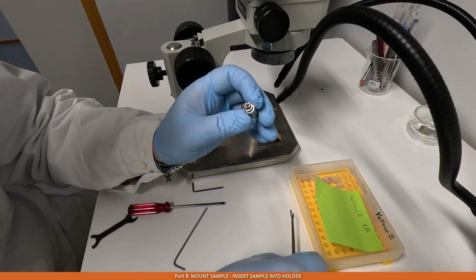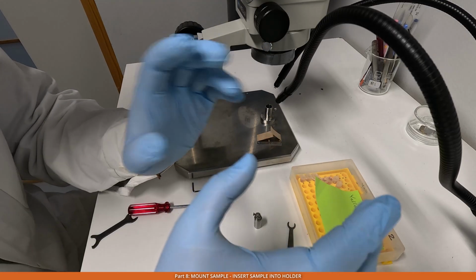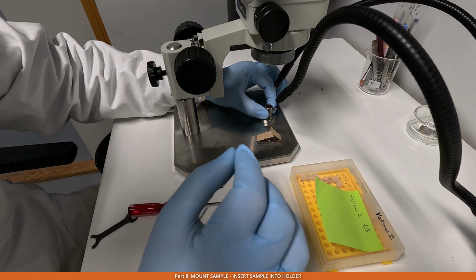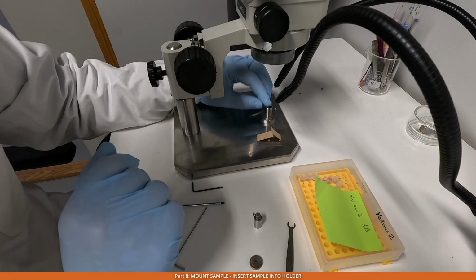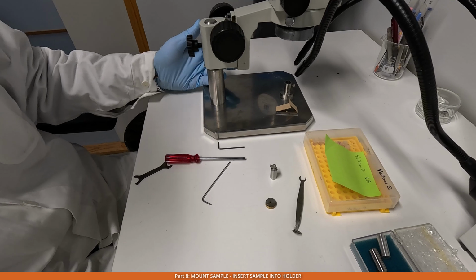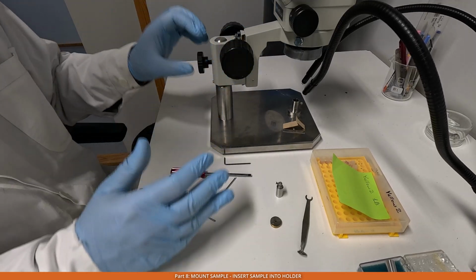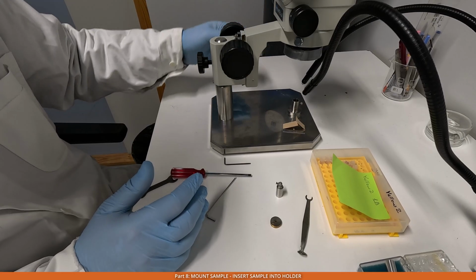So naturally the system needs to be calibrated beforehand, but usually it's quite straightforward, because what we do, we home the stage in the 3 view, and then we look where it is with the center of the pin, and then just move this adapter here at the bottom to bring the center of the pin into the center of the microscope. So the microscope itself sits here. I'll show you like this. So as it is, we do not tighten it, because if you tighten it, it gets a little bit shifted. So the best is to keep it into this kind of minimum entropy state, as low as possible.